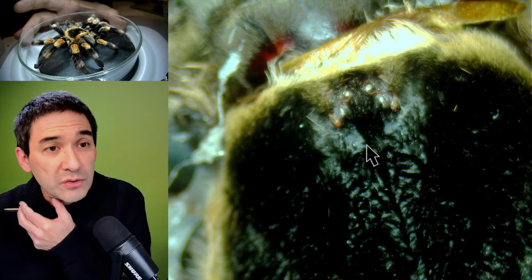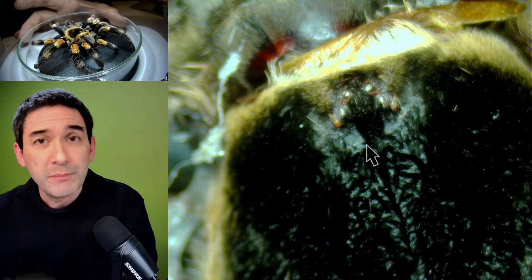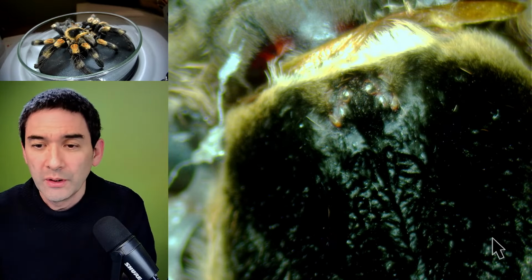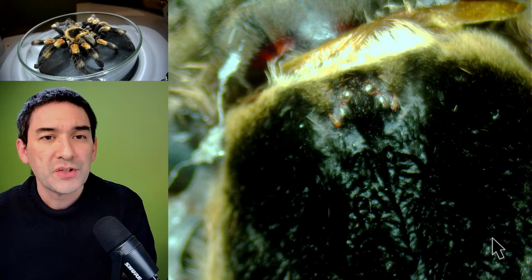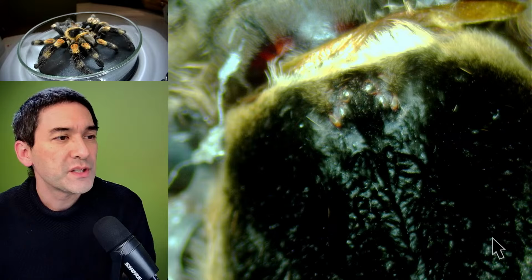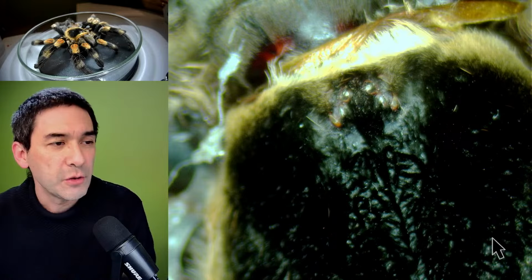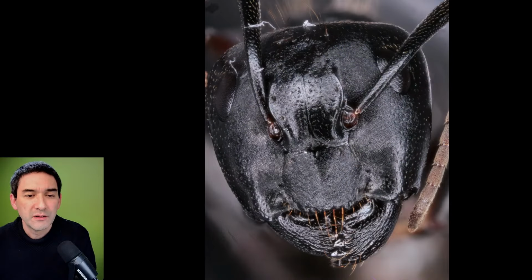What I would like to show you now is also some pictures that Mike sent me just today, a few hours ago. These are some pictures where we can also see some compound eyes, because we talk about insects and arthropods and spiders. So let's look, a picture of an ant. I don't know if you are in the chat as well. Maybe you can also comment on that.